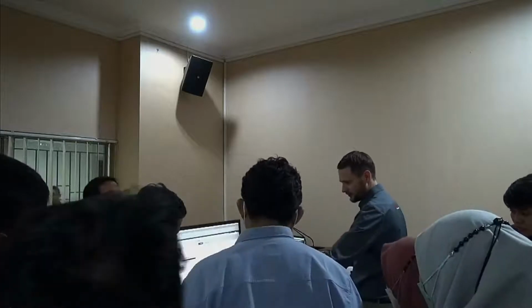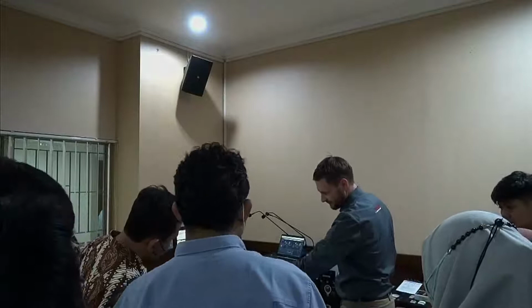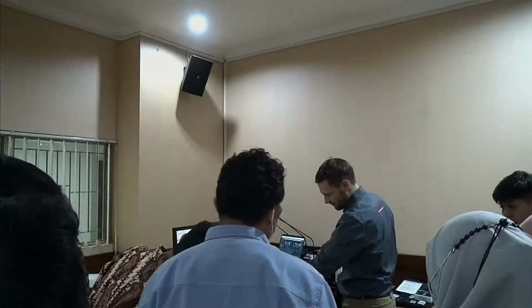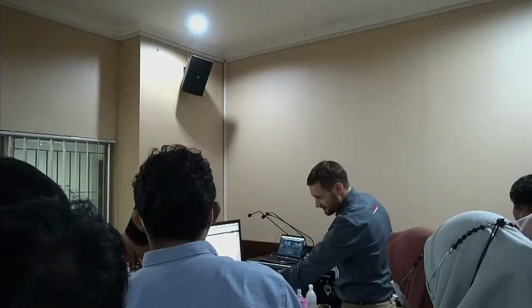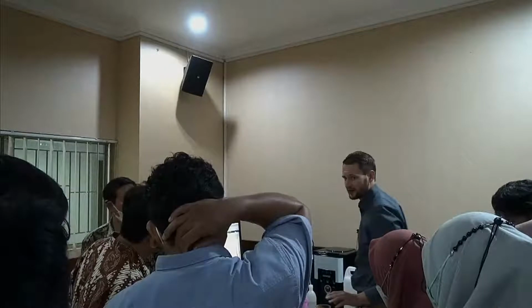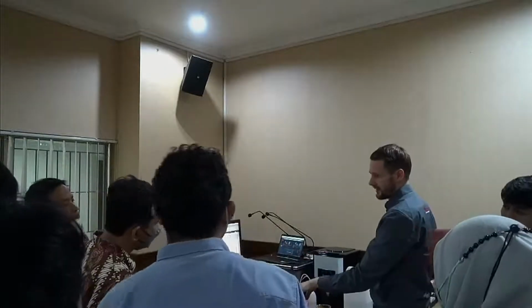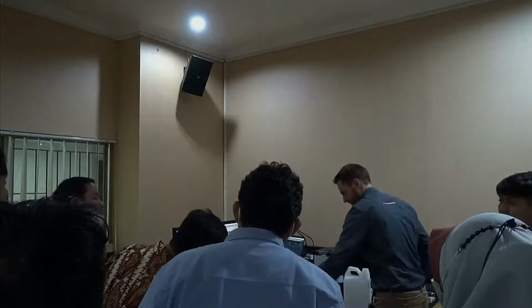It's actually very important to monitor your intensities. You see these are the 51 main detector elements and then the large angle and backscattering. In the background measurement, if you see intensities in this area, there's a pretty strong hint that you have dirt on your glasses. So it should be nice and flat as it is here. That's the way we want to see it.